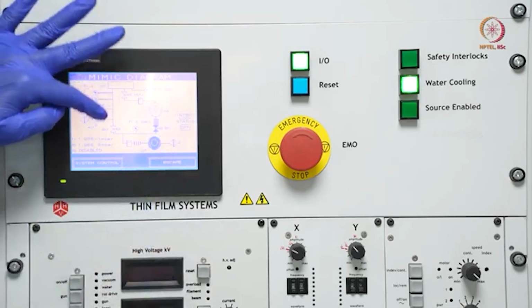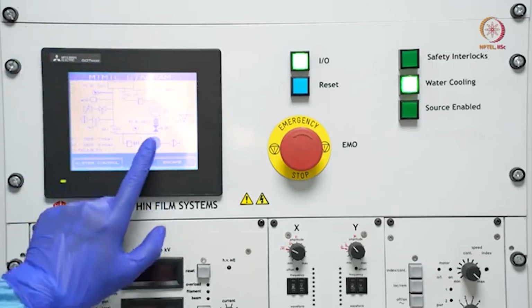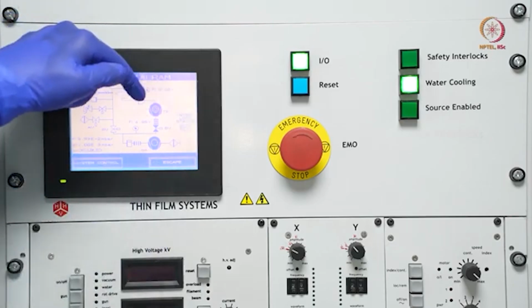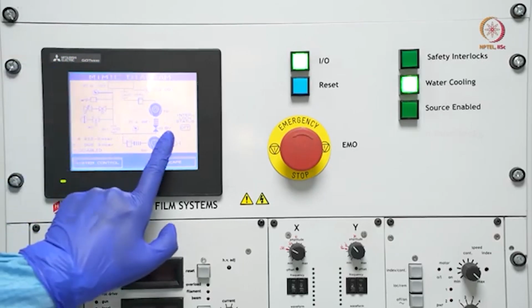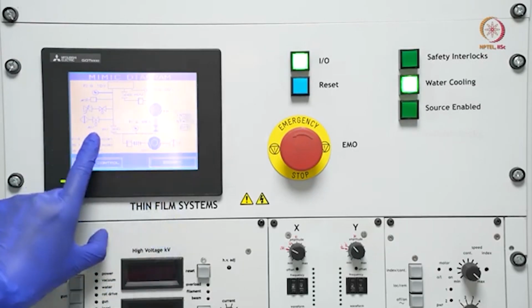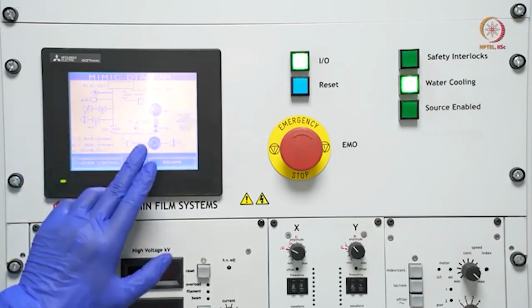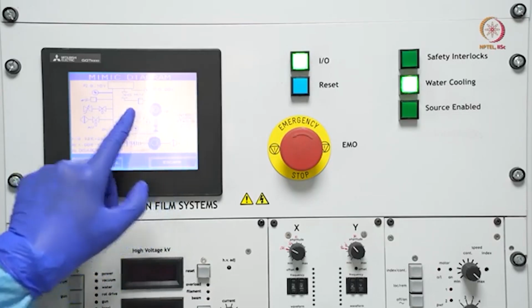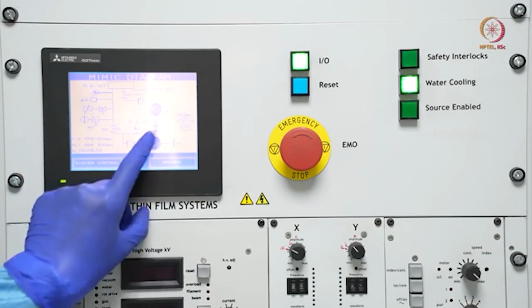How? See here, there are two lines. One is the roughing line, one is the backing line. Backing line is through this. Here, as you can see, this is our chamber, and through that we are taking the connection here. The backing valve is open, as it is glowing, as I already told, and the roughing valve is closed. So through this line we are creating the vacuum now. Why the backing line? Because before starting the turbomolecular pump, it wants some sort of vacuum. Okay, so that is the reason.